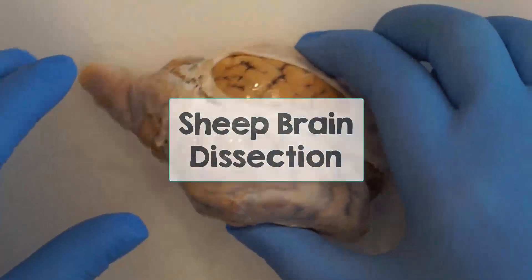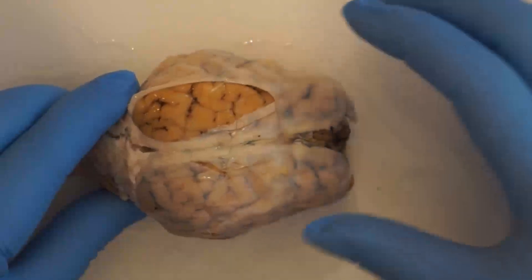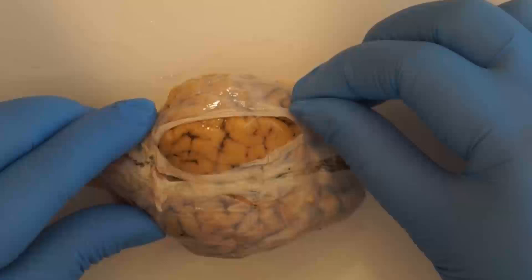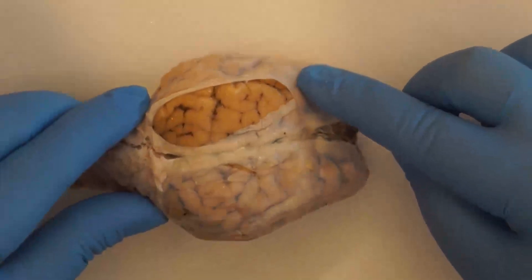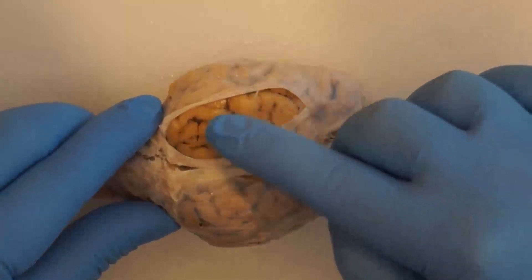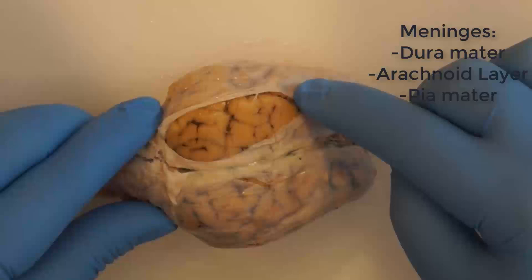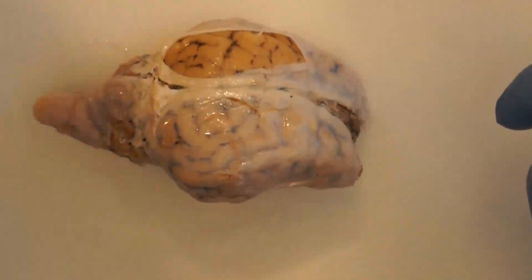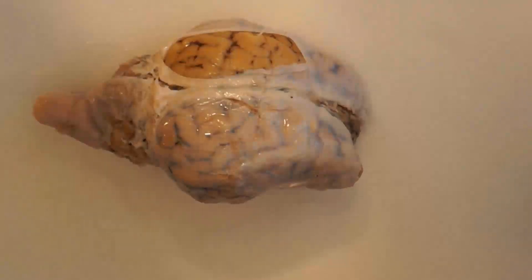Welcome to the Sheep Brain Dissection. Depending on where you purchased your sheep brain, you may have a white layer on top of the brain, and that is the dura mater — one of the layers of the meninges that are covering and protecting the brain itself. The first thing you'll want to do is remove that dura mater layer using your probe and scissors.